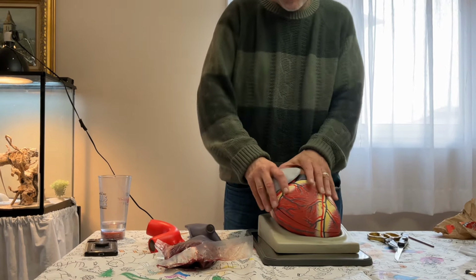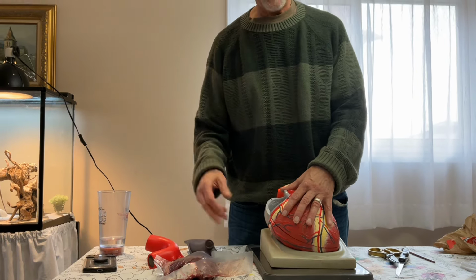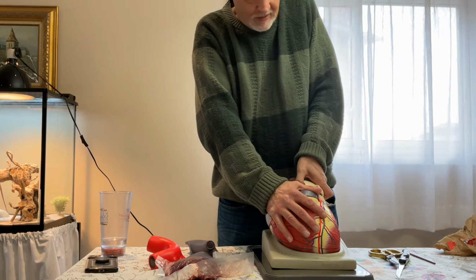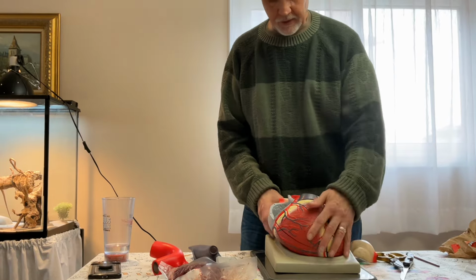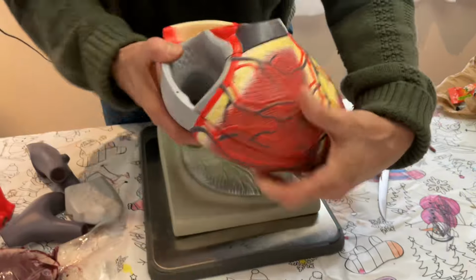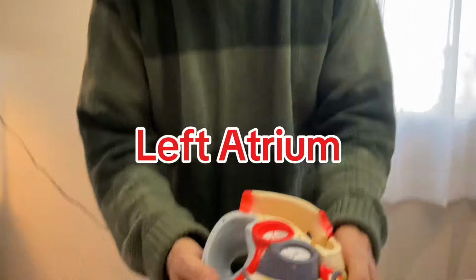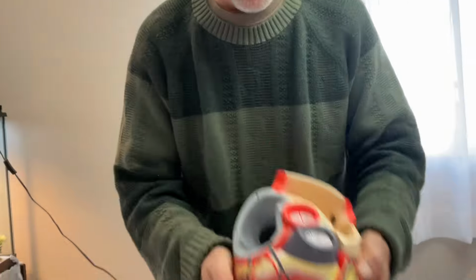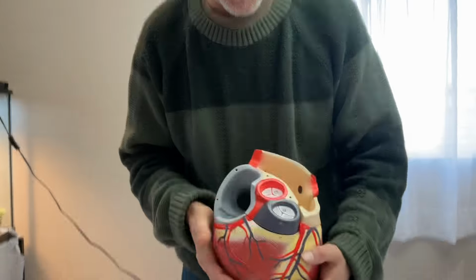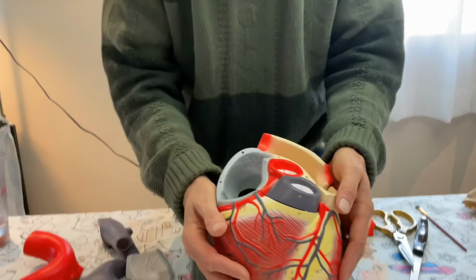And the first room you go into is the atrium. And let me show you into the atrium. Boom. Now you can't actually do this with your heart because you would die, but I can pull off bits of the heart and we can look inside. So if you look here, these are the atria. That's plural for atrium, and that means rooms. This is the right atrium, and this is the left atrium. And I always put the heart on my body to remember, because it's based on your perspective, left and right. So right, left might look different from you at home.